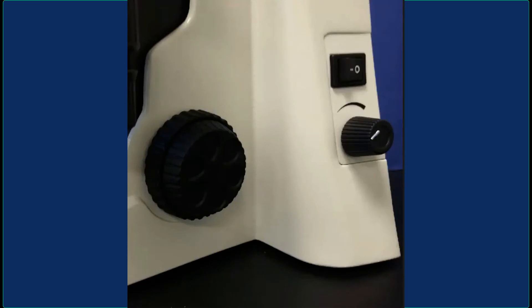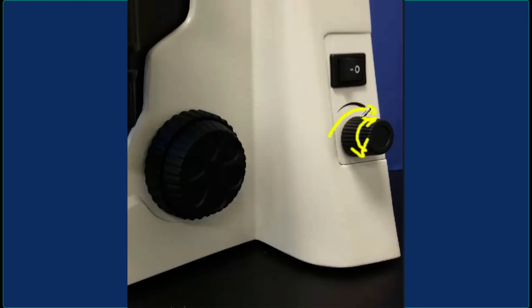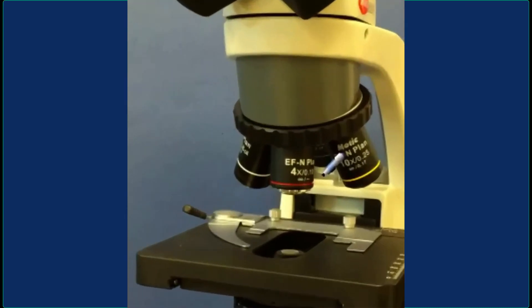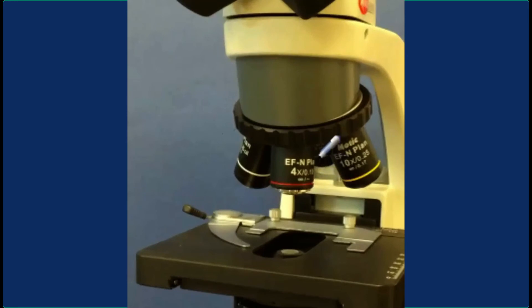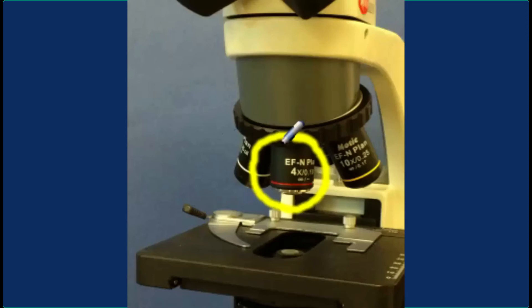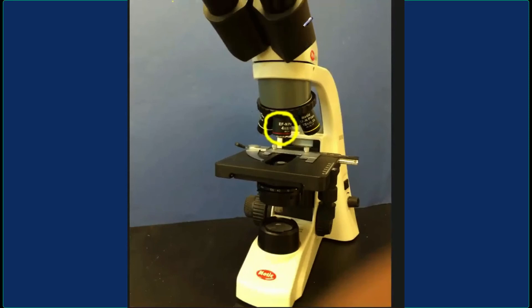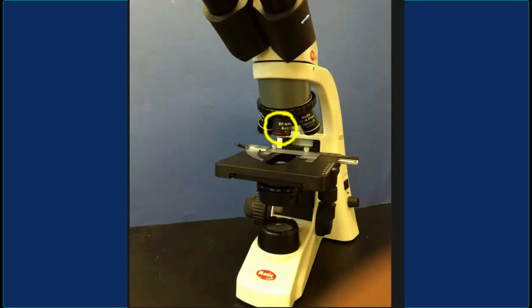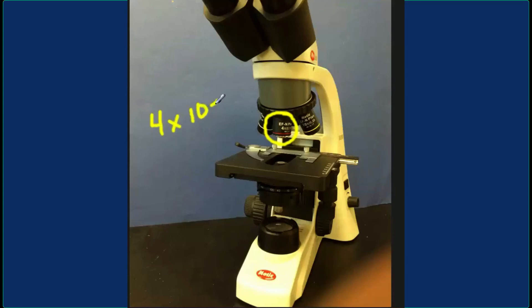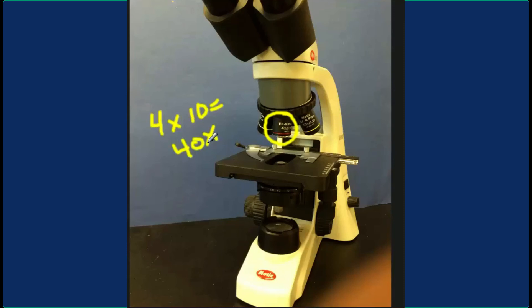Right over here is the rheostat adjustment knob that controls the amount of light going through your specimen — moving it in this direction increases light intensity. This is the switch that turns the microscope on. The 4x objective is the one you want in position when you first look at a slide. It magnifies the specimen four times, and the image is then further magnified by the ocular lens ten times, giving a final magnification of 4 times 10, which equals 40 times — this is the scanning objective.